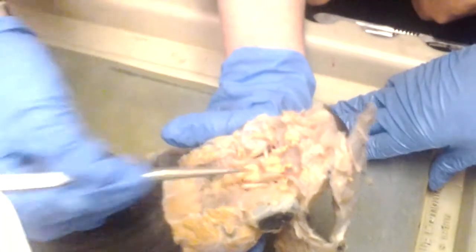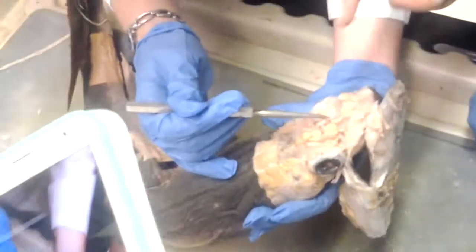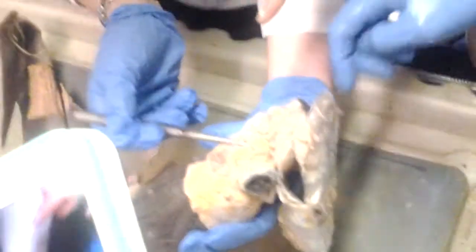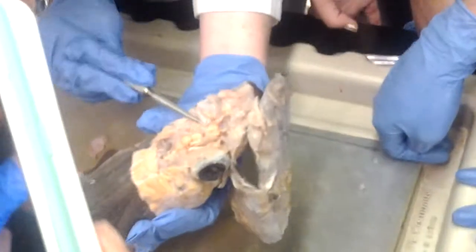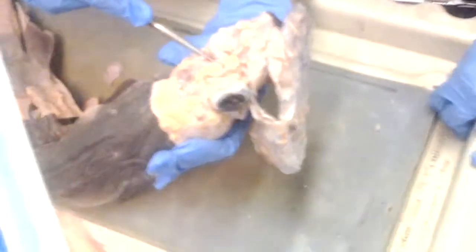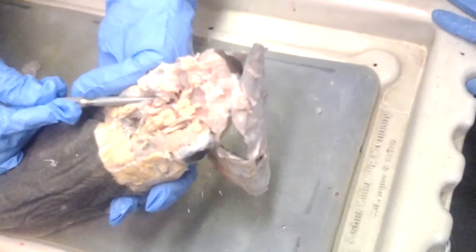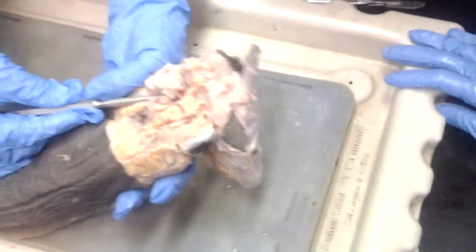Okay, now we also needed to know the pedestal. Yes, the pedestal. Which one is the pedestal? Oh, here it is. What is that? The optic pedestal. It holds the eye in place. Pedestal, pedicle. So let's pull it out a little bit. See it? Pedicle or optic pedestal, however Dr. Waller pronounces it. Does he call it pedicle? Yeah. All right, well, the optic pedicle or pedestal.